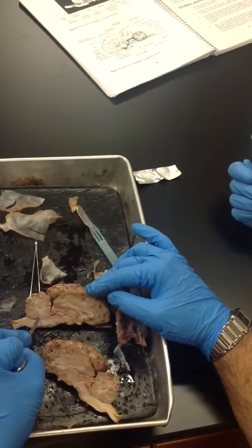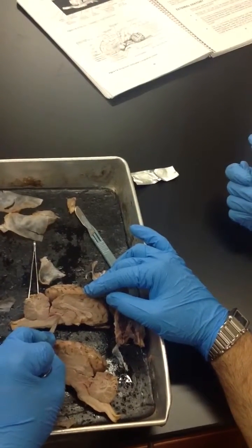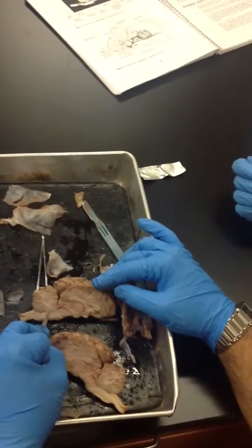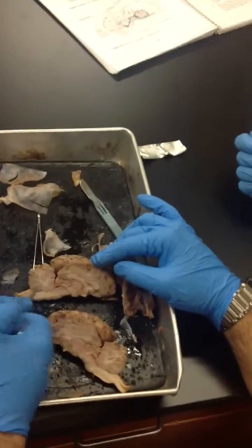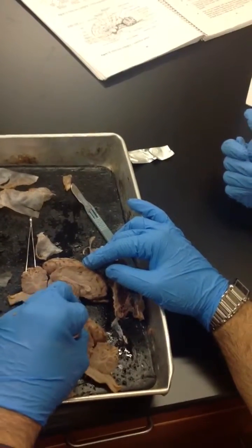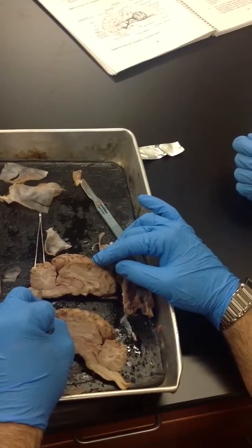underneath the cerebellum. See how there's like a gap right here? So it goes from the third, so this is the aqueduct right here. So this little space is the aqueduct, and it connects it to the fourth ventricle. So this is 1, this is 2, the third ventricle, the cerebral aqueduct, into the fourth ventricle.